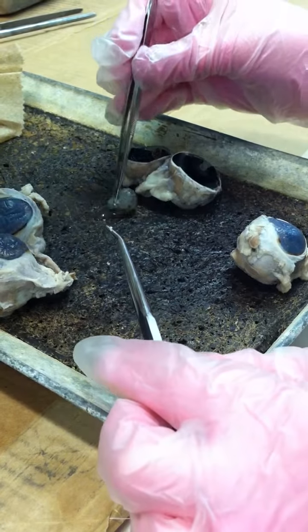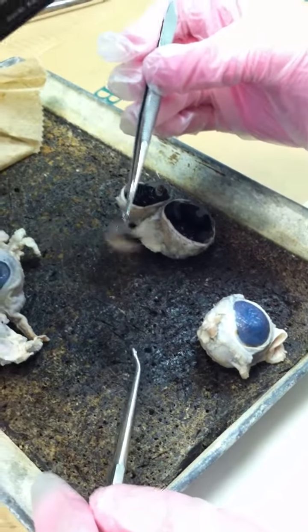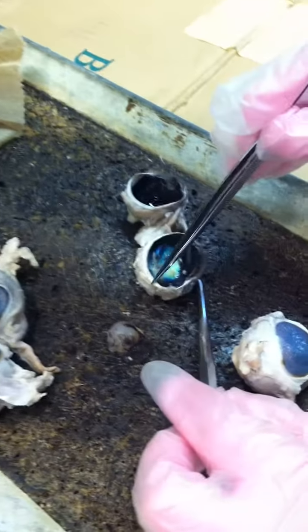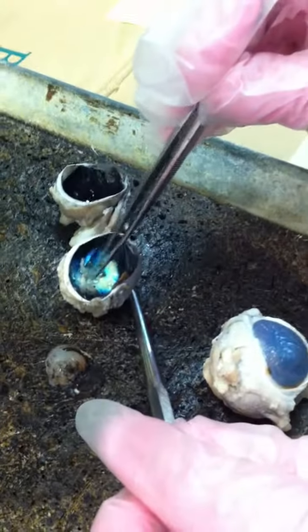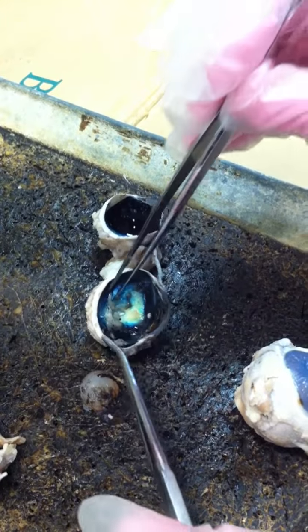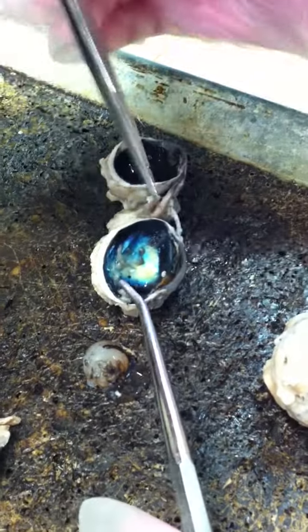Inside the eye, you have the lens, which is sitting here, and then you take it out. So this is the lens. It's covered in vitreous humor. And, all right, so look at that. This white portion is the sclera. Then you have this blue, nice, shiny stuff. That is the tapetum lucidum. The black stuff here, that's the choroid. And then the retina is this filmy, mucusy stuff, a really thin film that covers the whole back portion of the eye.